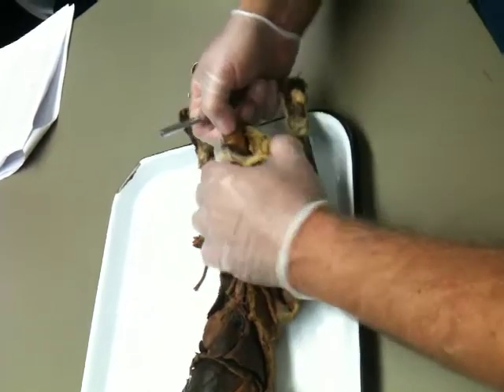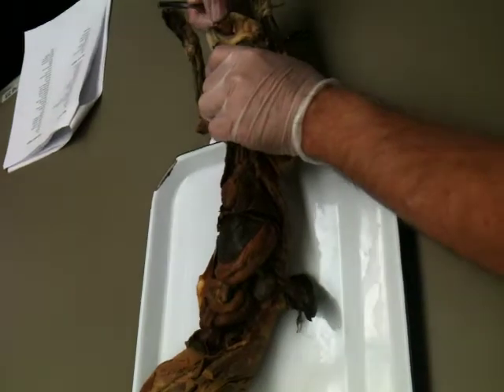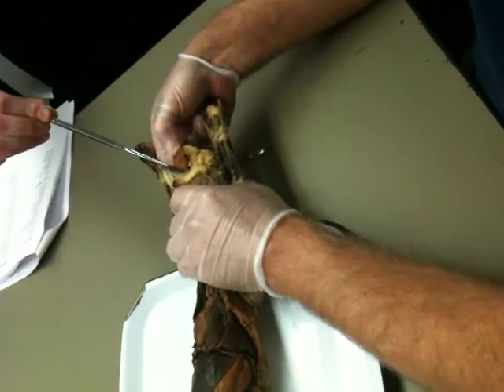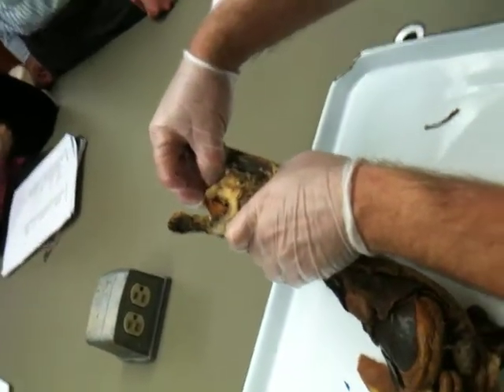If you pull the tongue away from the cat, there's a membrane in there that's holding the tongue to the floor of the mouth. Can you take the probe, somebody, out of my hand and point to it? Yeah, okay. I just want to be sure that that's enough. Can you see it then? He found it, so maybe you can see it, the membrane.